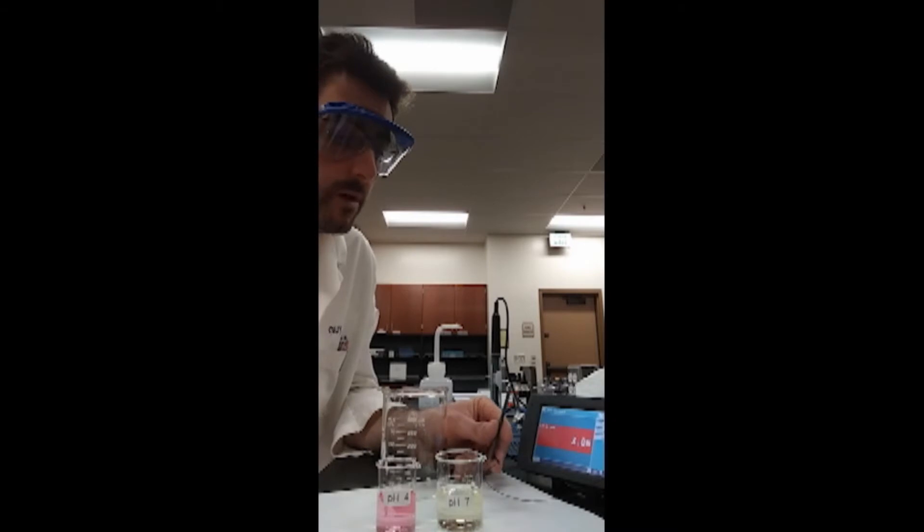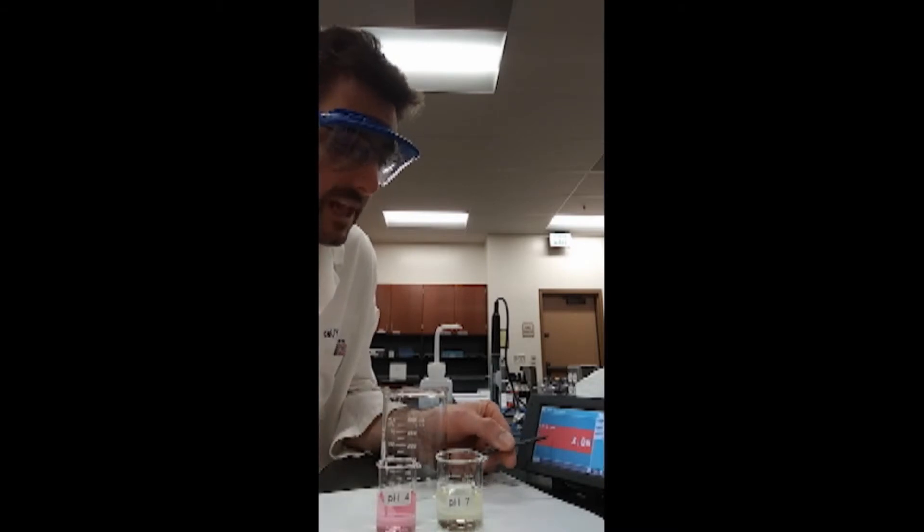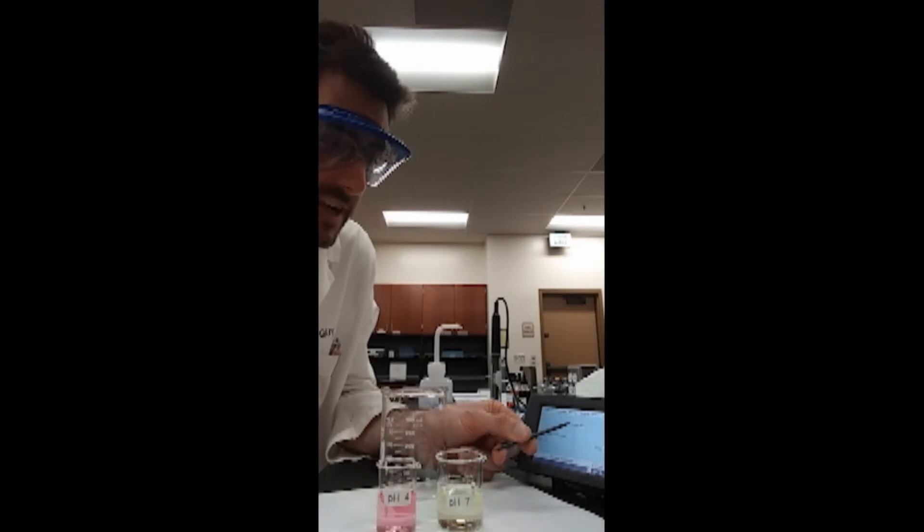So, here we go, we're going to start by opening up the calibration screen, by tapping on calibrate, and then of course we want to go about calibrating our probe. We'll choose calibrate now.